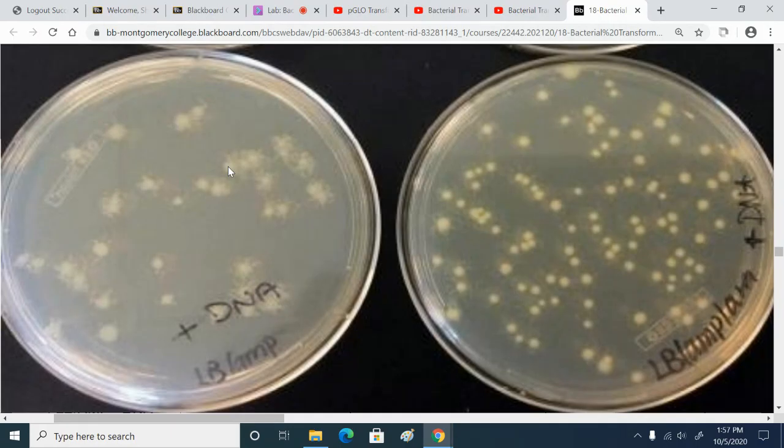Yeah, it always happens, or almost always happens, especially if you give the plates a long enough time to incubate and grow. That way the transformed colonies destroy all the ampicillin, and those few cells that were not transformed were hanging on. Now they're able to start growing. But they're growing only because they're next to transformed E. coli.